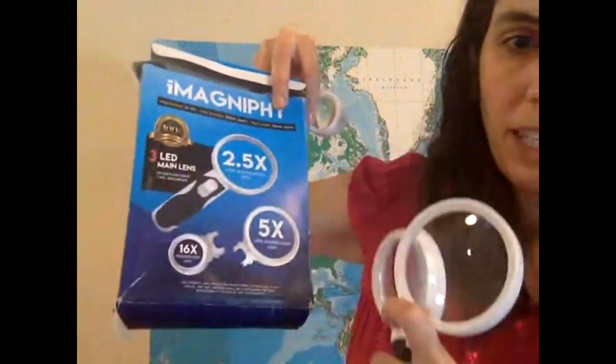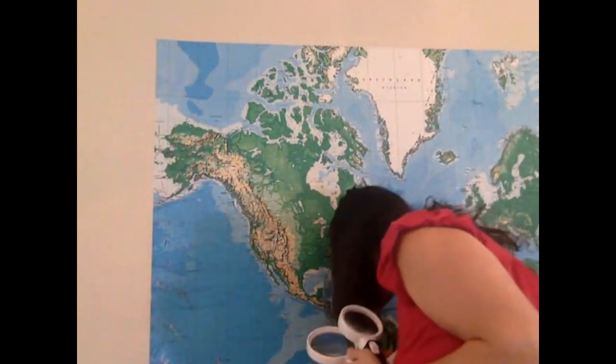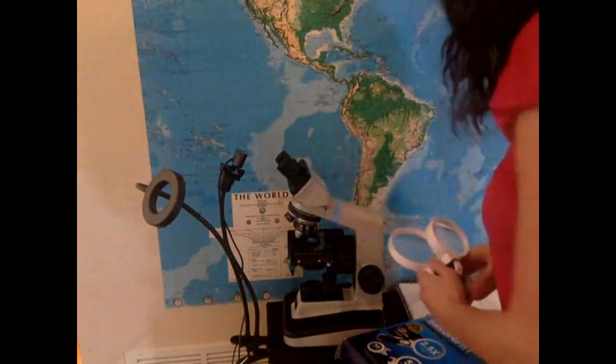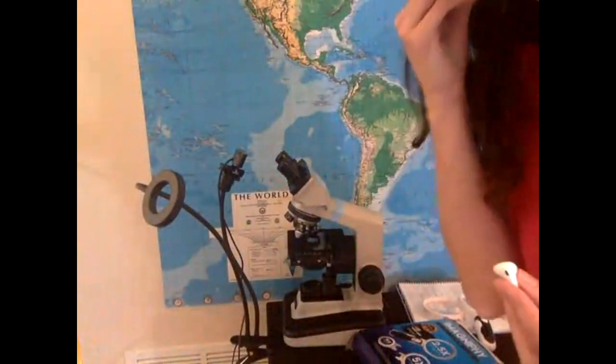And okay, 5 times and 16 times. So in the microscope, we have these guys, which are 10x.